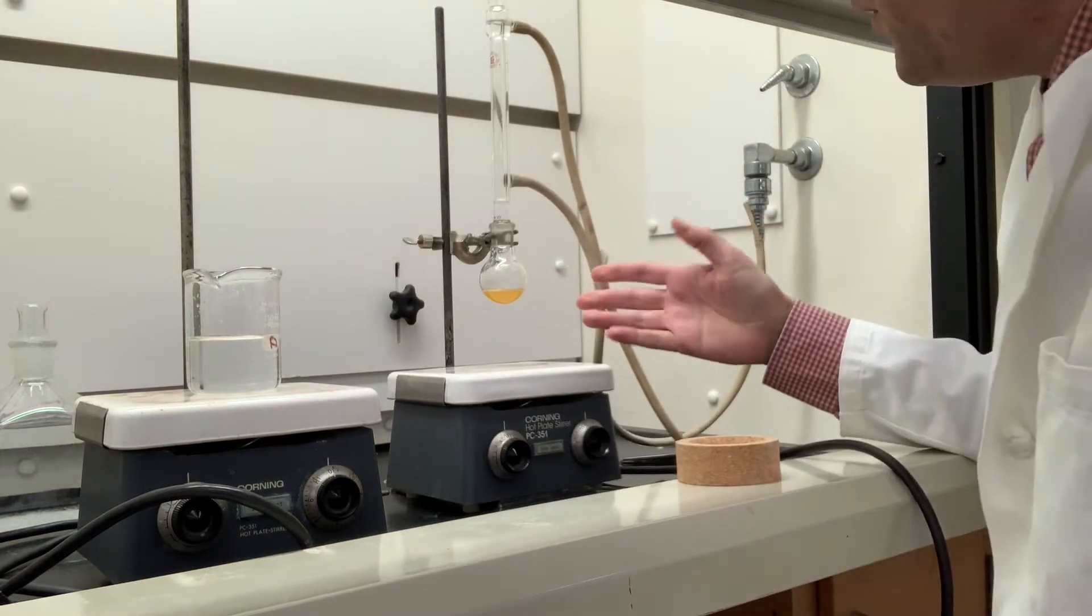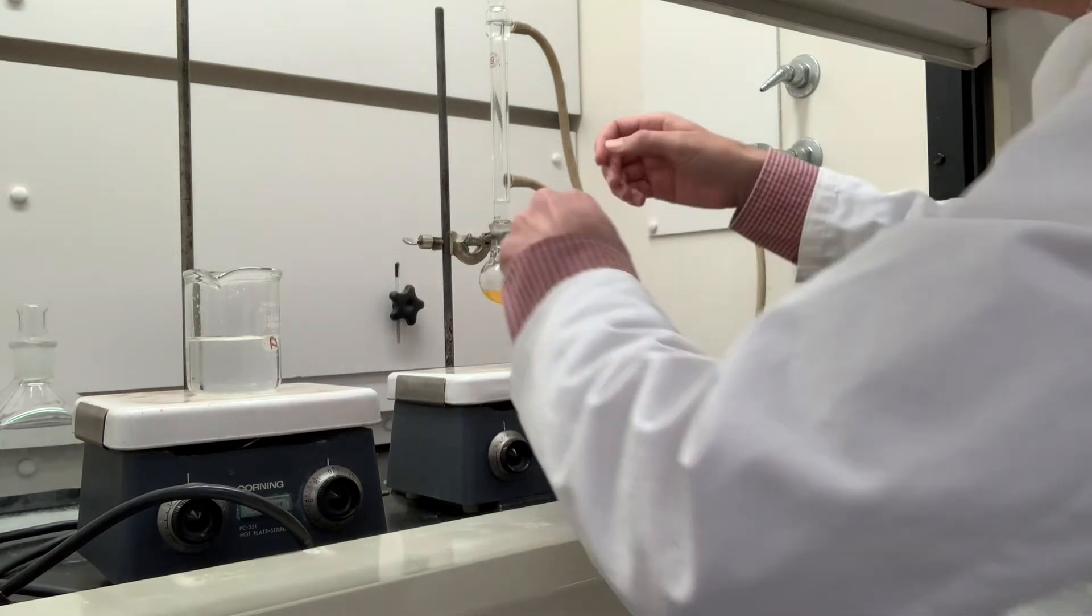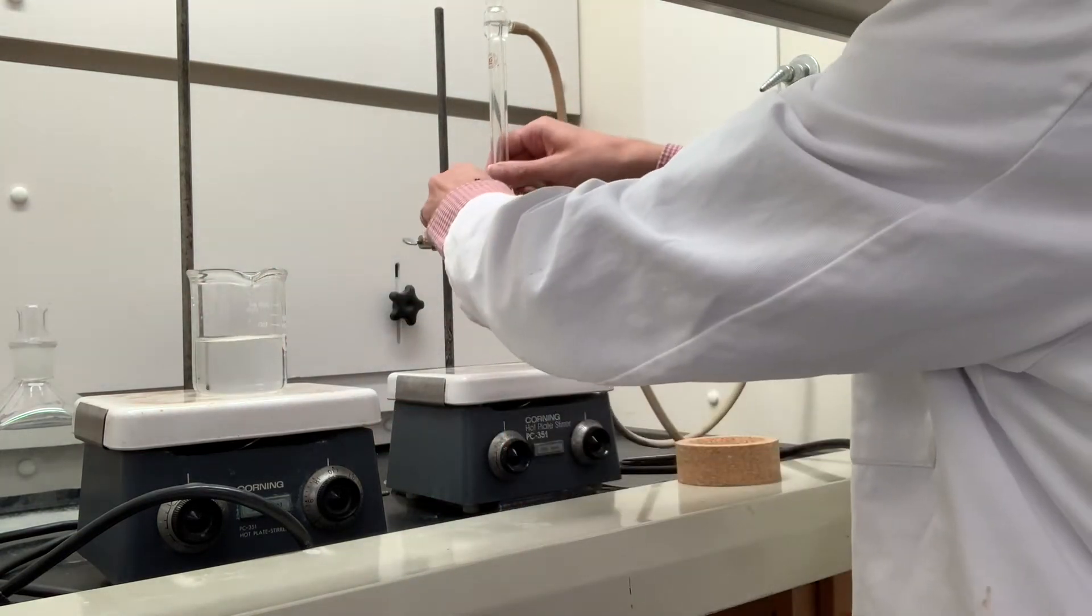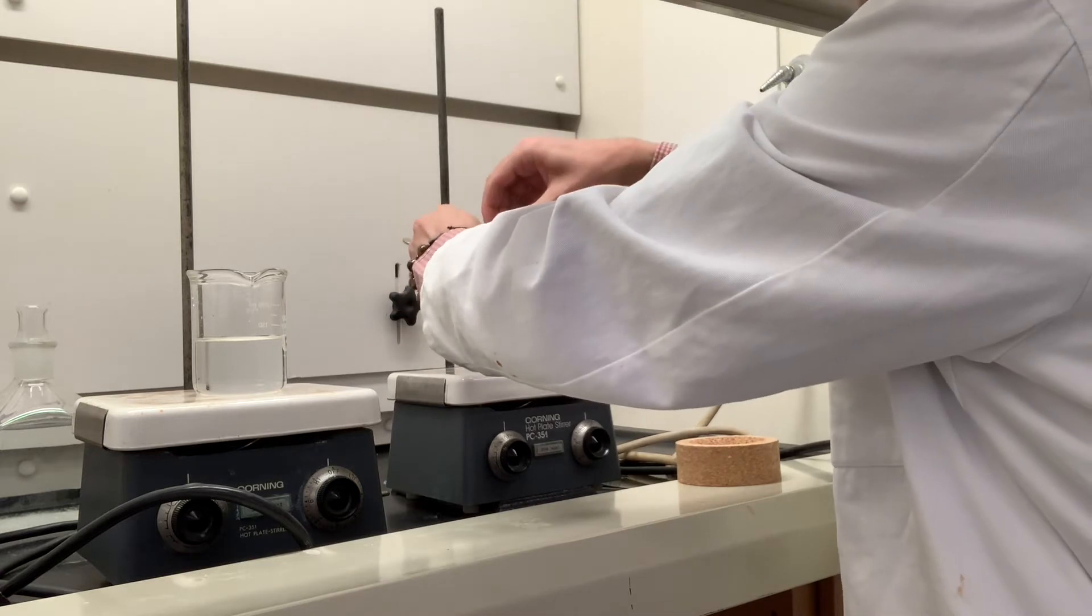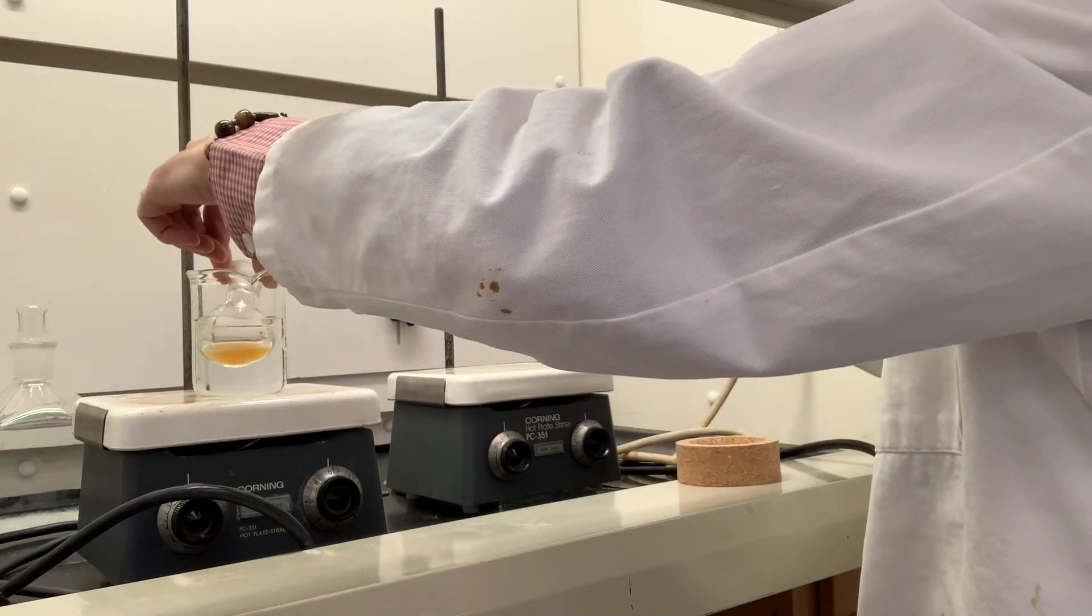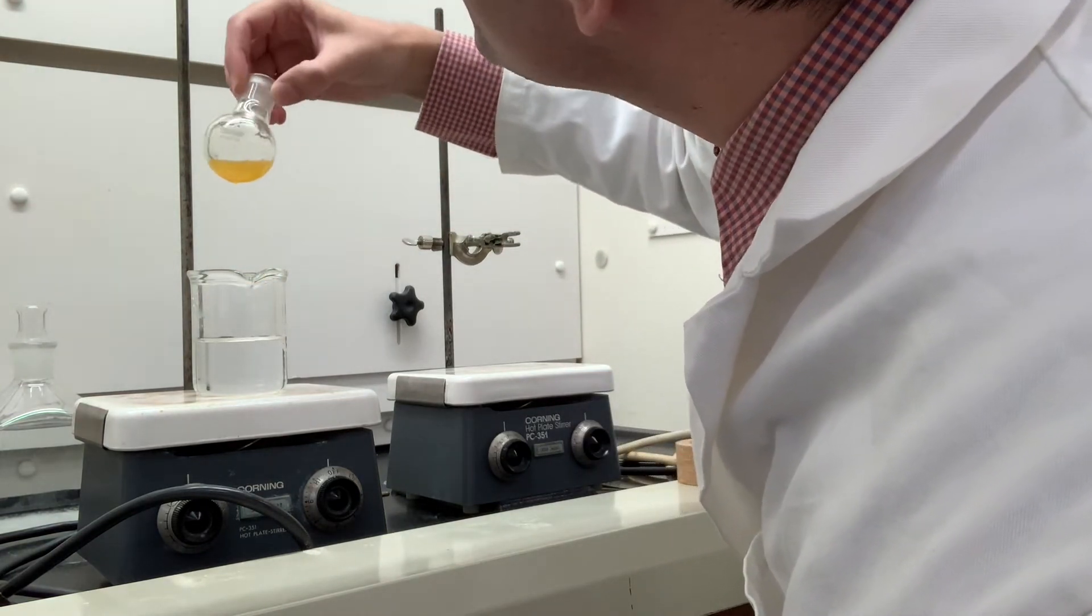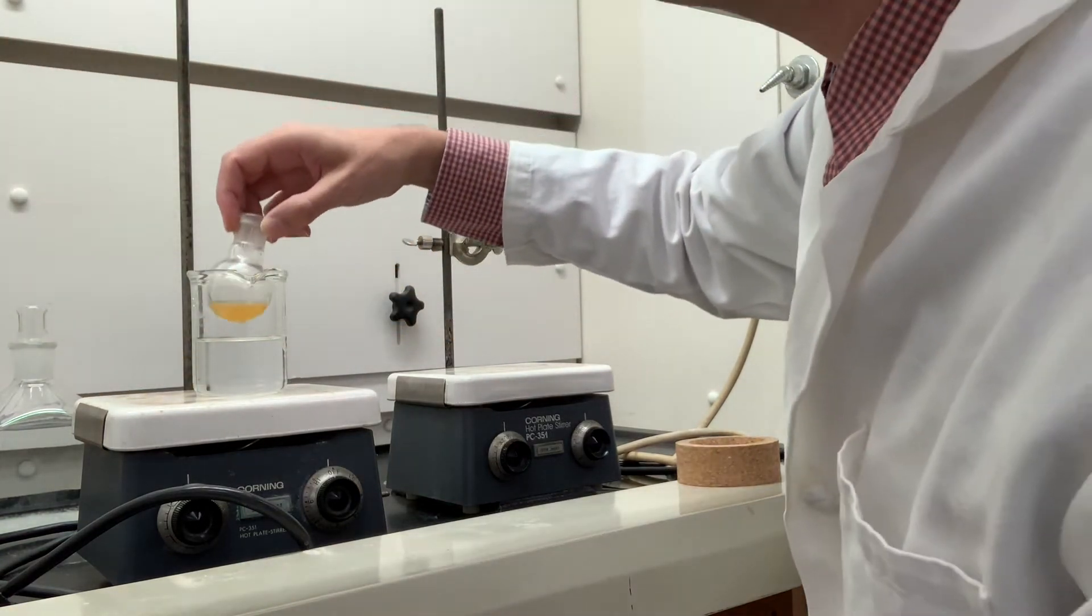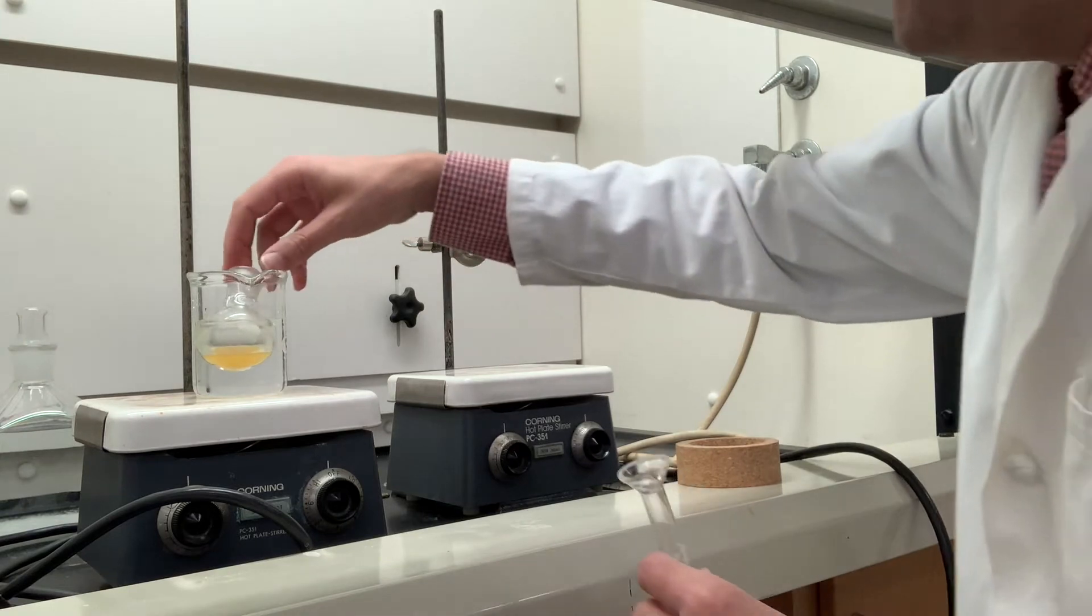It's still boiling in there, so the procedure says to cool it to room temperature for about 15 minutes. I like to put it in some cold tap water to facilitate cooling. I'll take this reflux condenser off and let this float there in the water. It's very slightly cloudy - there's not much in the way of precipitate. I'll let that sit there and come back after 15 minutes.